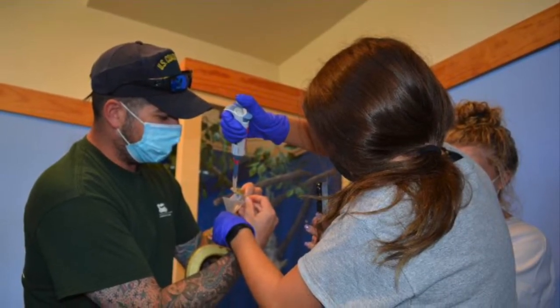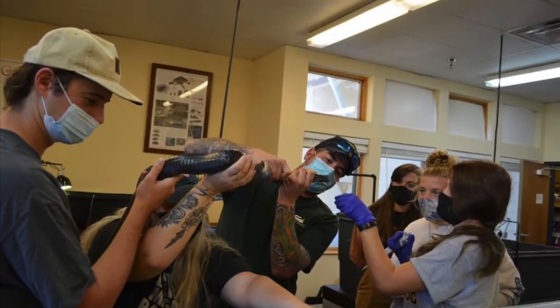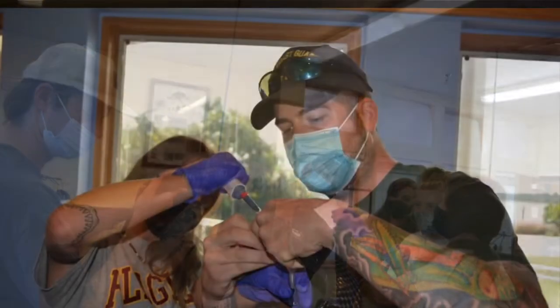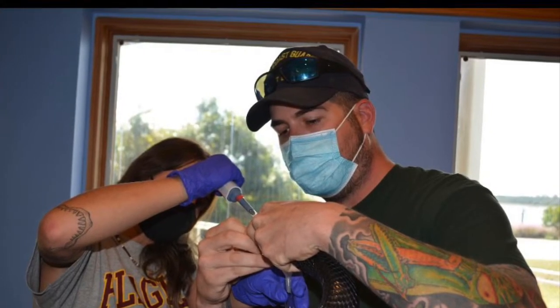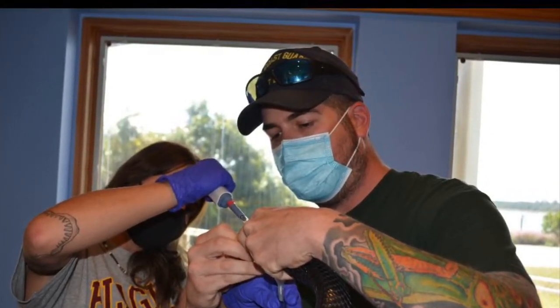We were fortunate enough to have access to a variety of non-venomous snakes. Some of these snakes sampled belong to fellow classmate Shane Smith and some of the snakes sampled were kept at the GTM NER. Here you can see us collecting the saliva from an eastern indigo snake that belongs to the GTM NER.